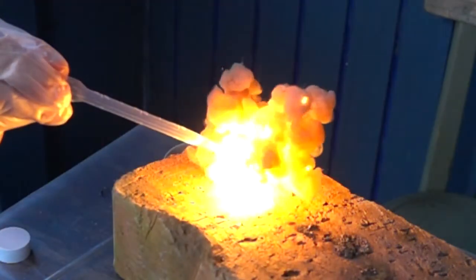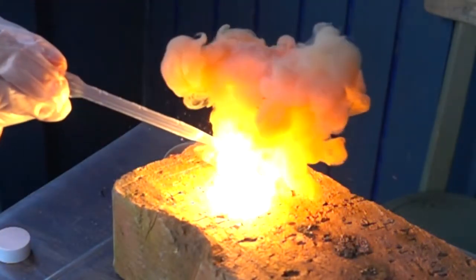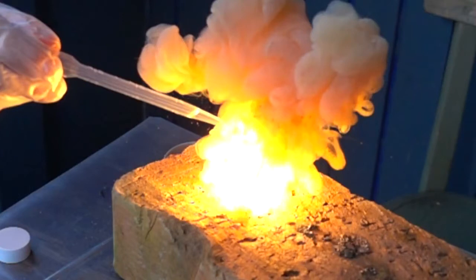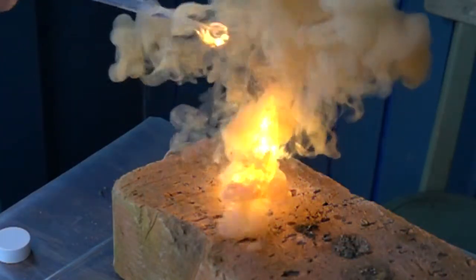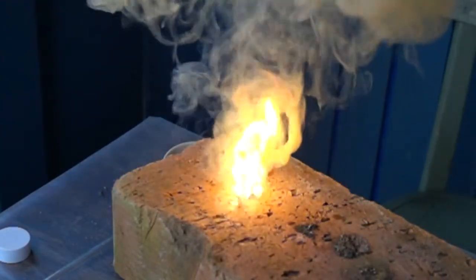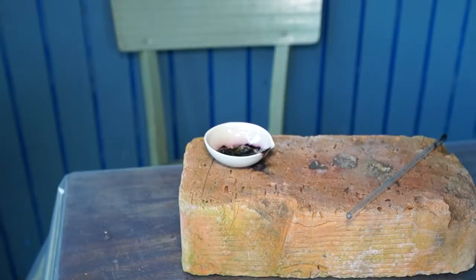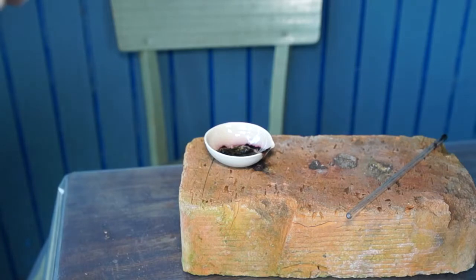At contact of alcohol with manganese oxide, the alcohol instantly ignites. Let's do the same in this evaporation bowl.